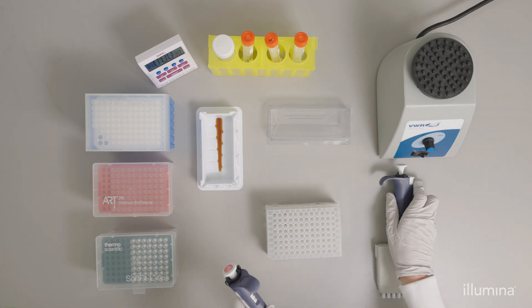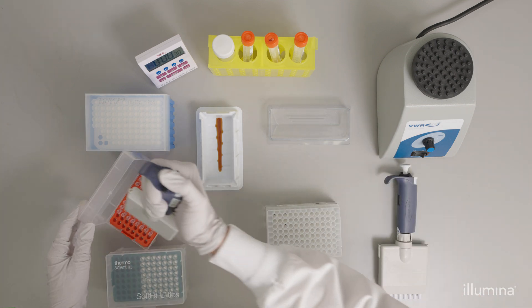Then, use a 20 microliter multi-channel pipette to remove any residual supernatant remaining in the well.